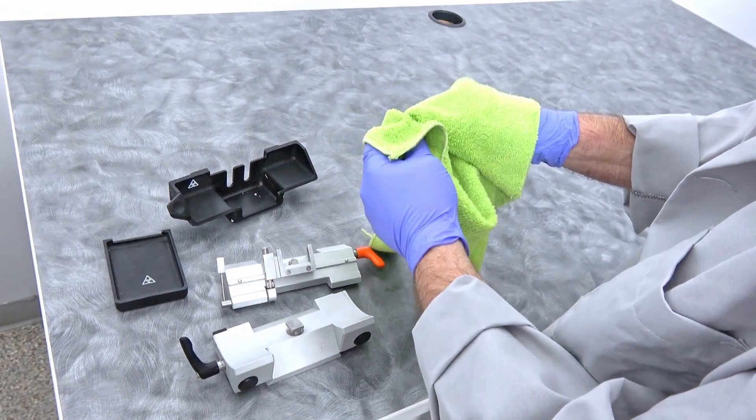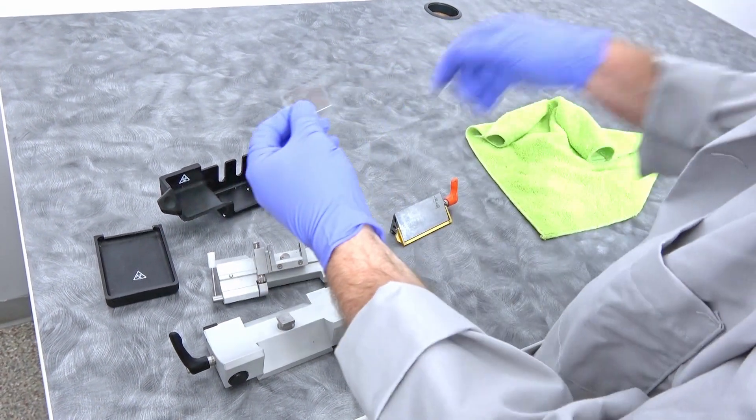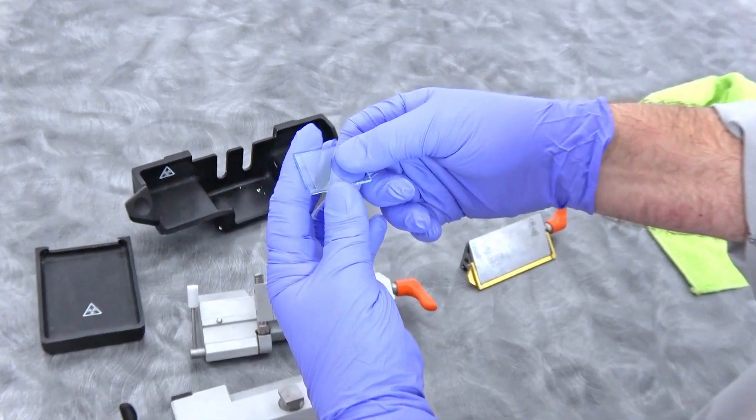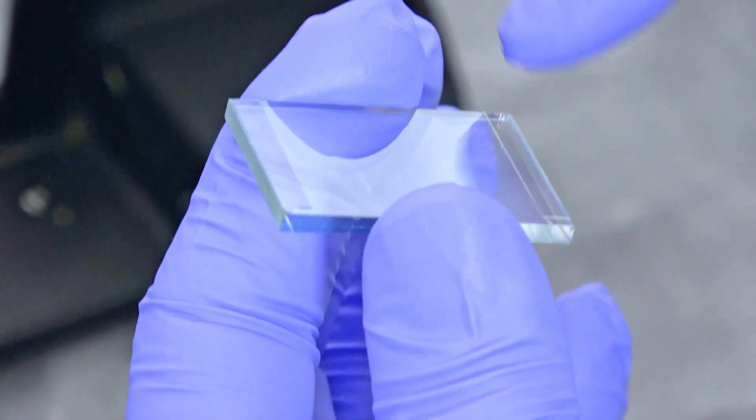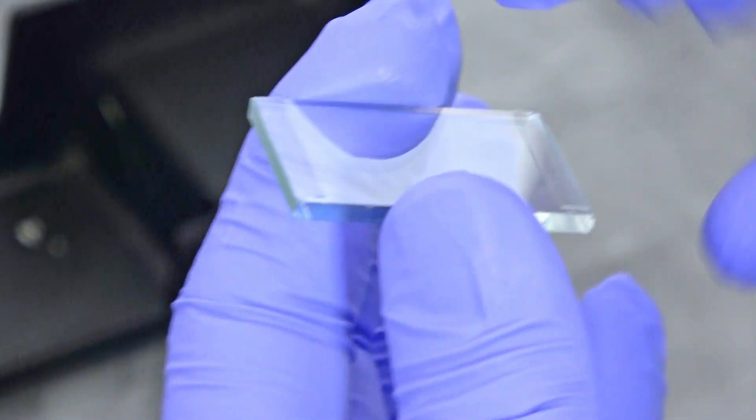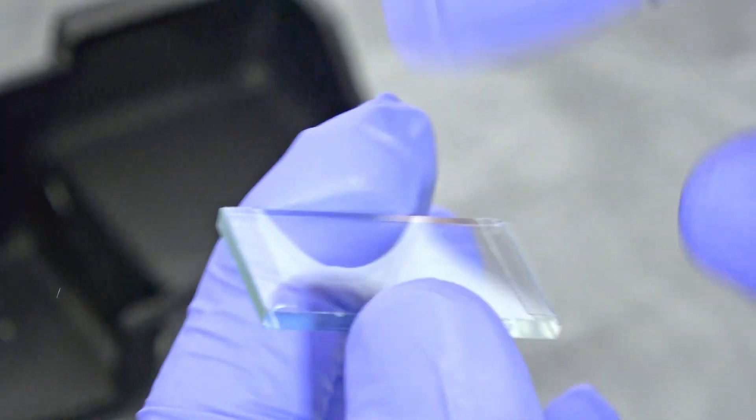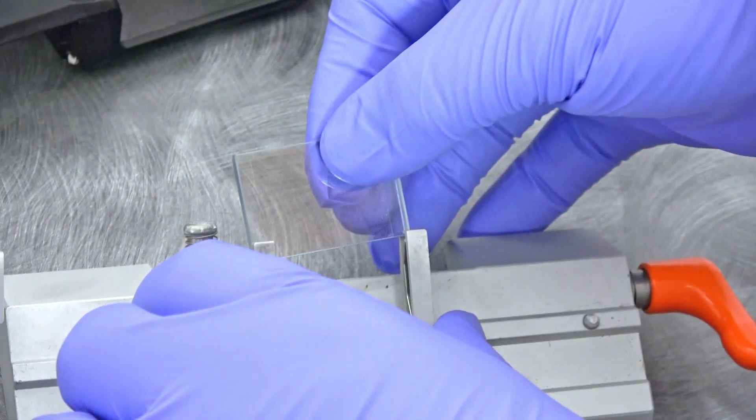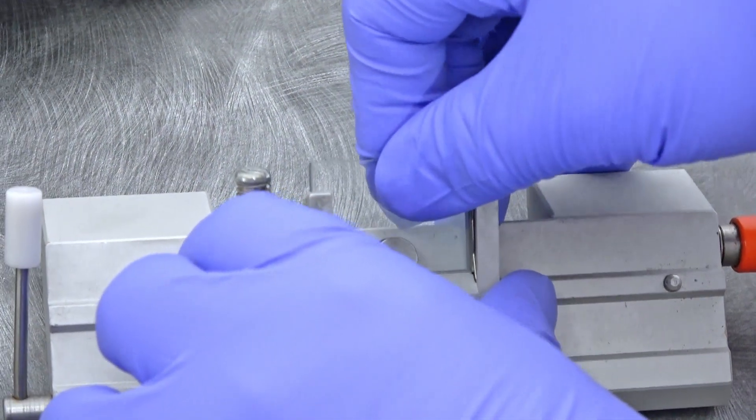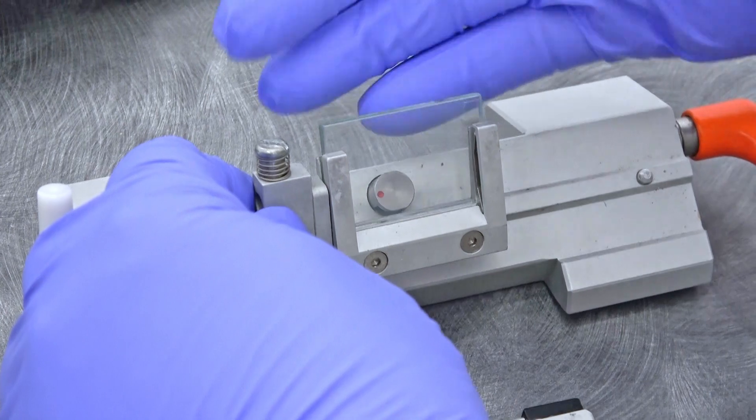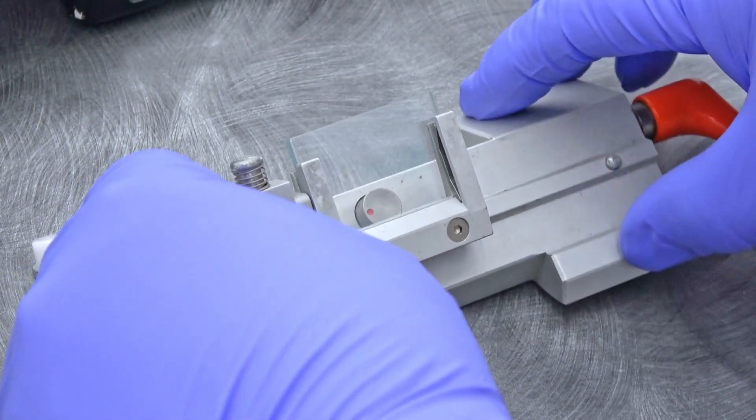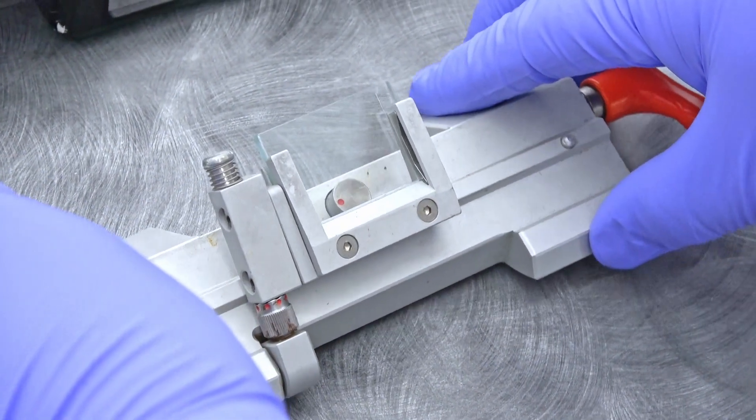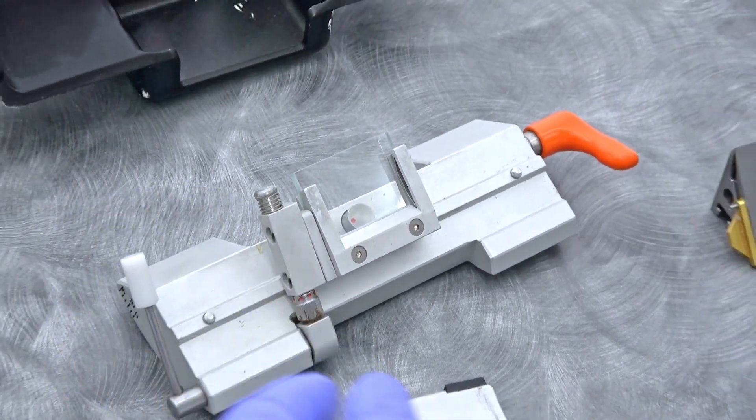You can slide your glass out and clean it, so you got a nice clean glass. You want to make sure on your glass here you can feel the edge. You want to put that edge down and slide it in here again, put it all the way down because this is the edge that measures that distance.